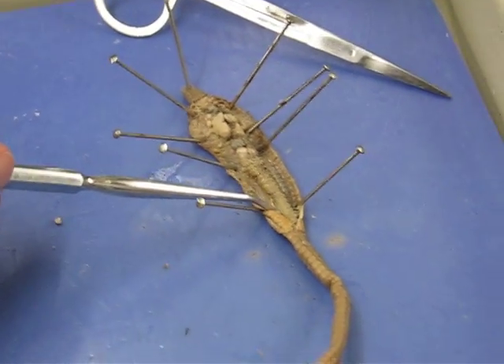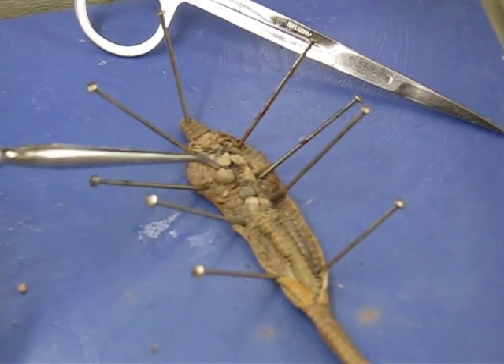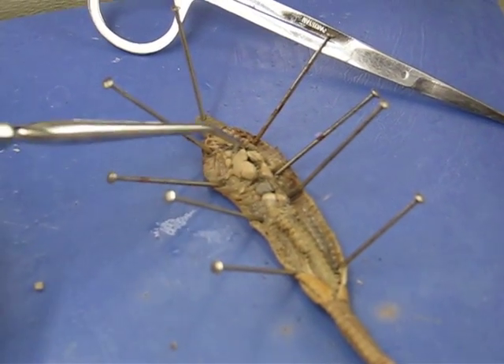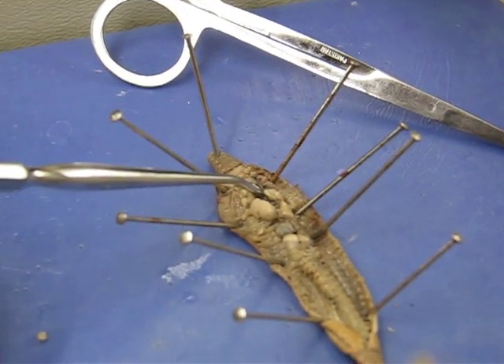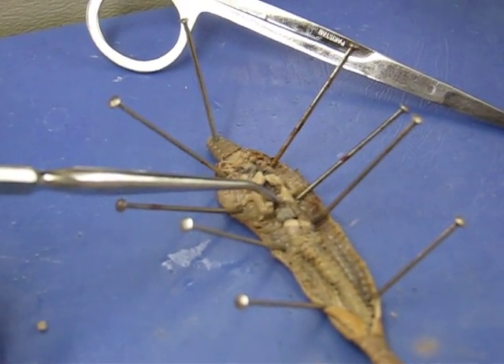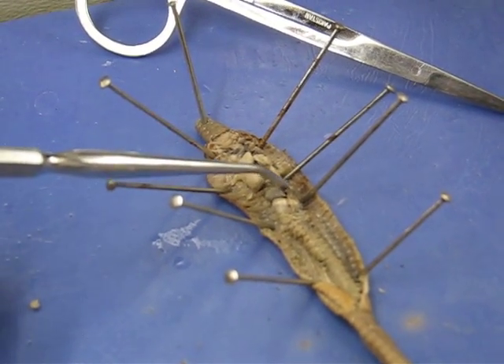Yours is a little botched — it's not too bad. So what we have is the esophagus right down here, this tube down here travels up like that, and comes up to the crop which is here.